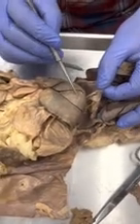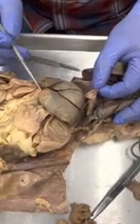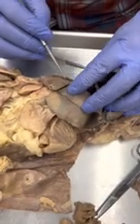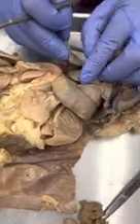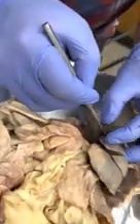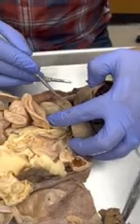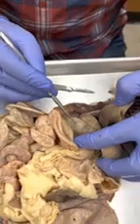So this is the left medial lobe of the liver, left lateral lobe of the liver. Here is the right medial lobe, and yours is a little different here, because usually what we would see right here is the gallbladder sticking out. So I got to pull that open, and then we can see the gallbladder right there. Most of the other cats, you can see it kind of externally. If I pull these out, there's a right lateral lobe, and this is the caudate lobe right here.